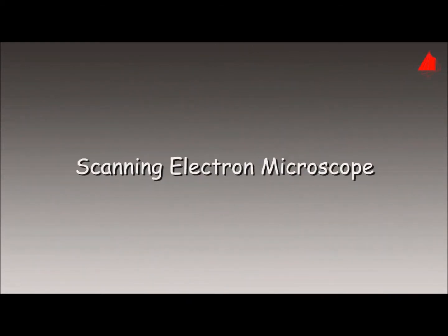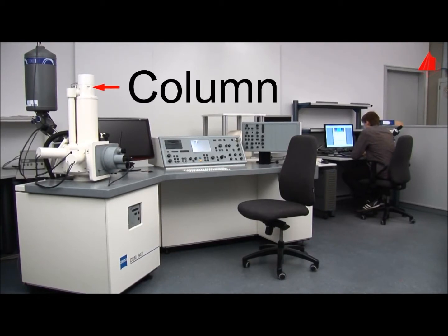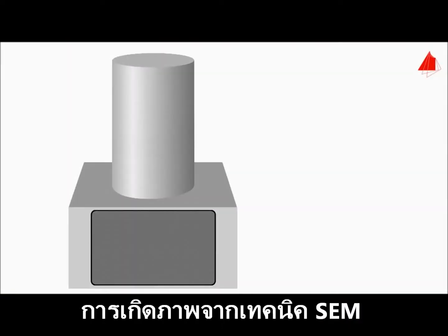The Scanning Electron Microscope. Main components of the microscope are column for electron beam generation, specimen chamber, vacuum pump, monitor, and control panels. The animation first shows the schematic structure from the outside. The upper part is the so-called column. It is used to generate an electron beam. The lower part consists of the specimen chamber with cover plate.